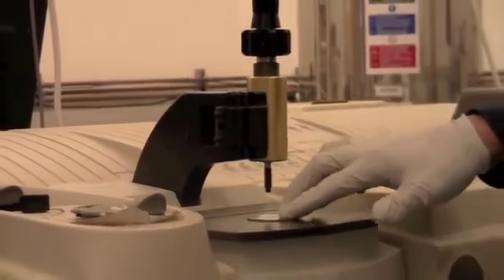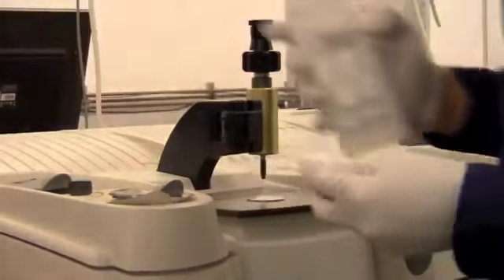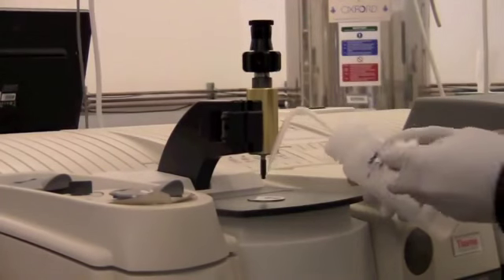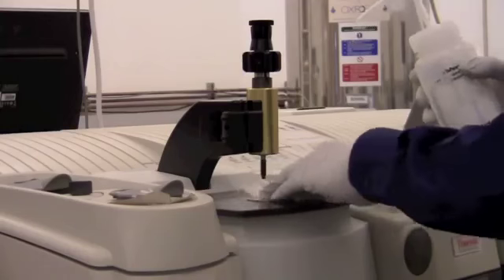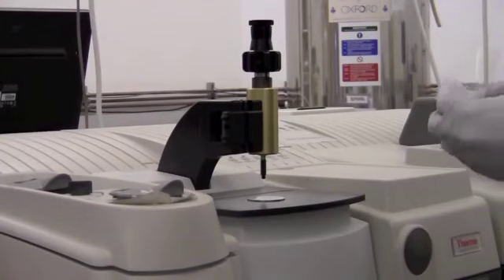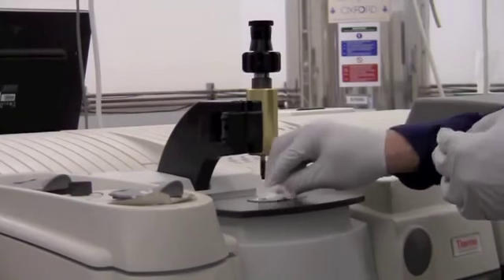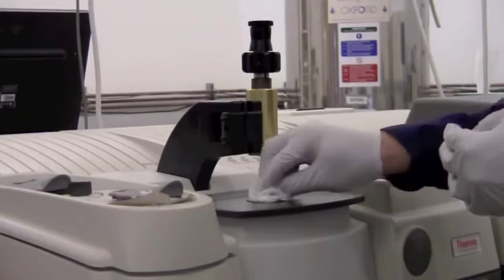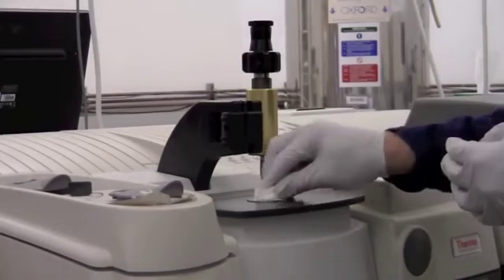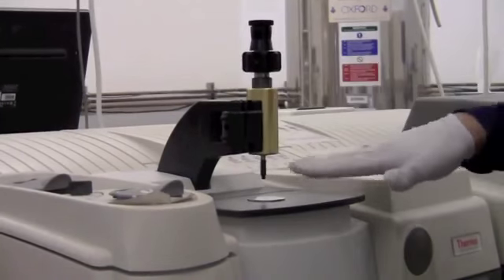And for that, you want to make sure that the stage is clean and the top of the diamond is clean. The diamond can take most any solvent. Only limitations are strong oxidizers and strong acids. So don't use something like sulfuric acid or chromic acid. But then you can use whatever is necessary to clean off the prior person's sample and make sure it's ready for your background spectrum. When you're collecting the background, you should not have anything over the diamond.